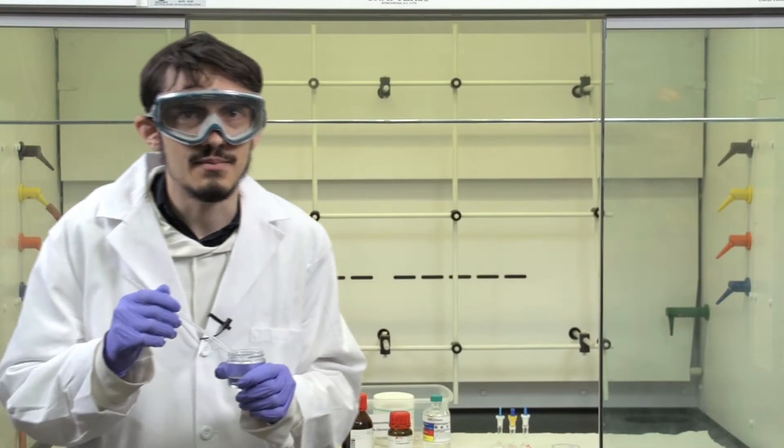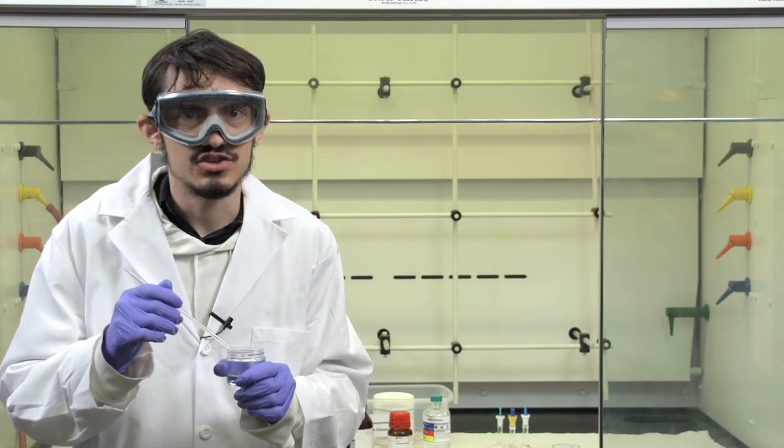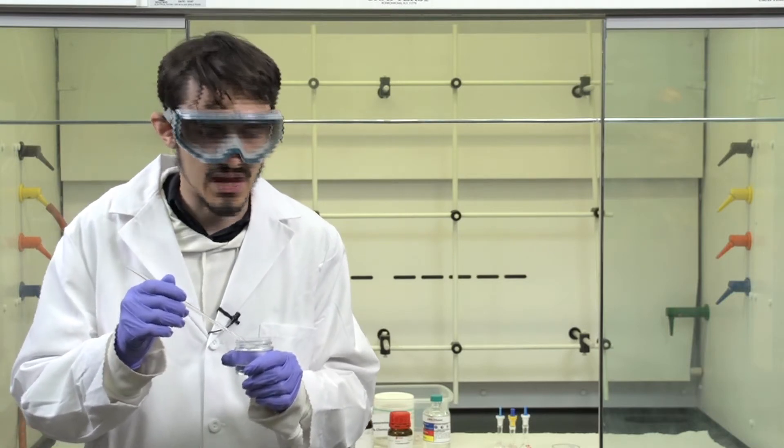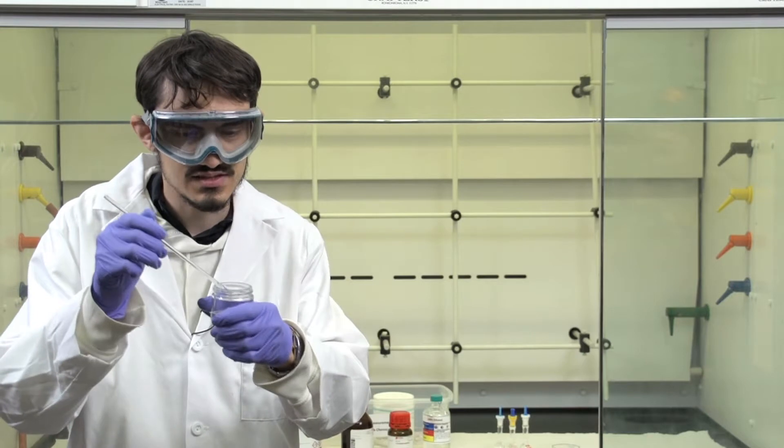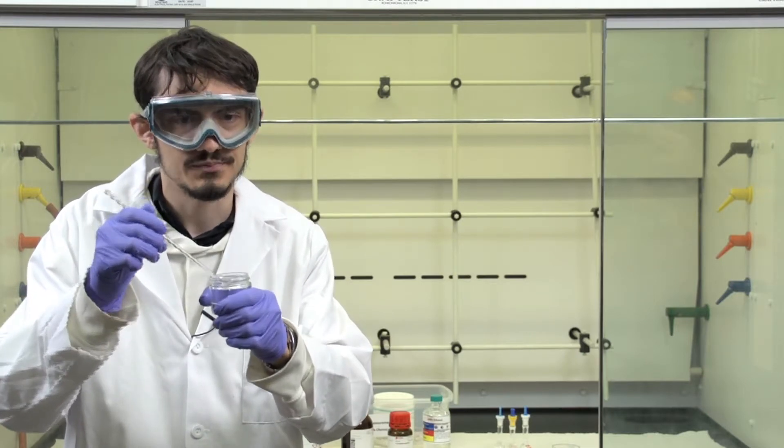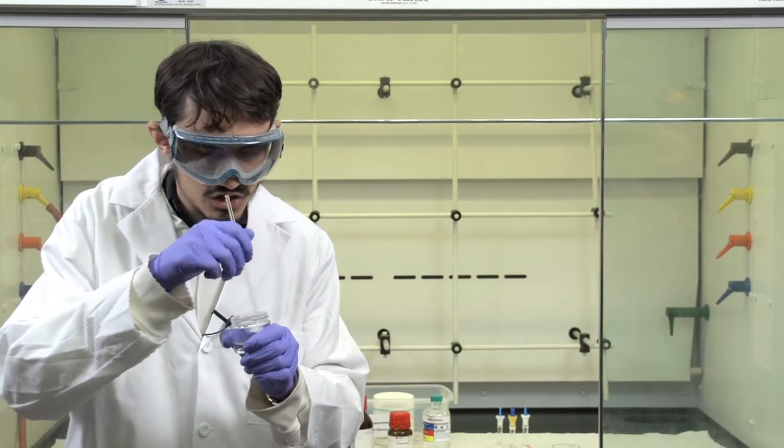After weighing out the appropriate amounts of PDMS and curing agent as specified in the lab manual, you want to make sure this is weighed out in a disposable jar and stir carefully.